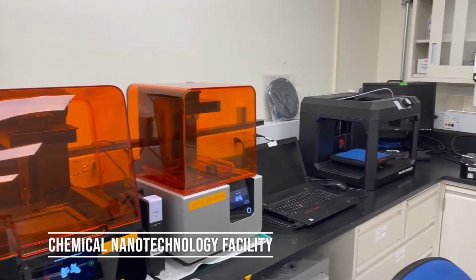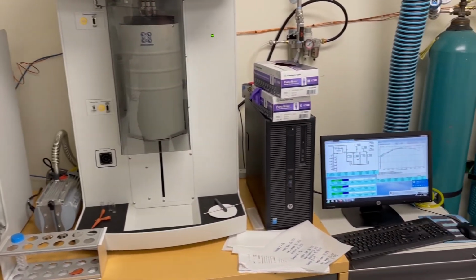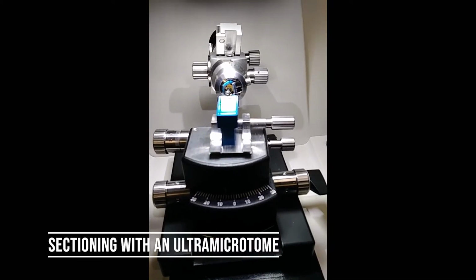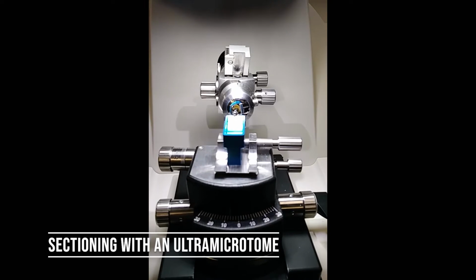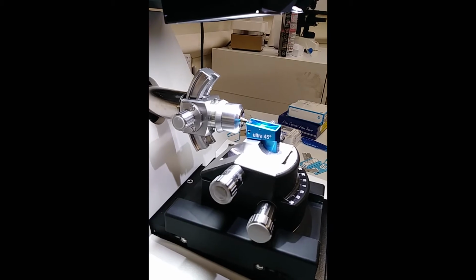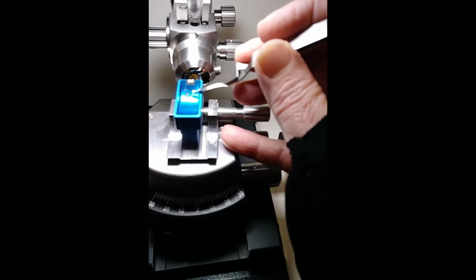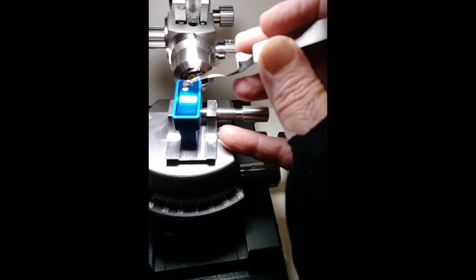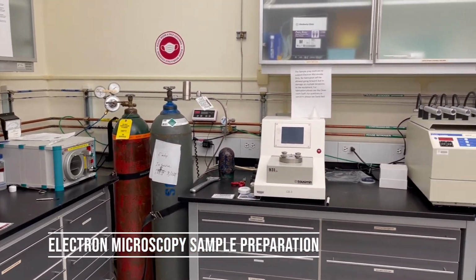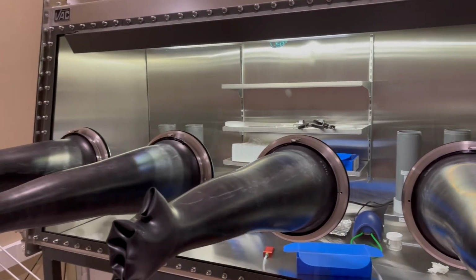We have a selection of prototyping tools, characterization tools, and wet bench facilities, along with a dedicated biomaterials space. The biomaterials space houses our serial sectioning equipment, which is used to make samples for transmission electron microscopy. We also have a separate electron microscopy sample preparation space, which is primarily used for preparing hard material specimens.